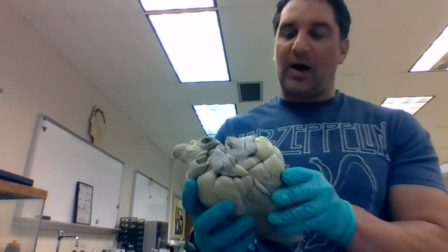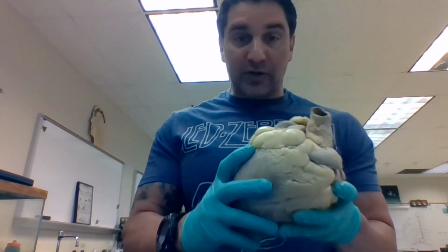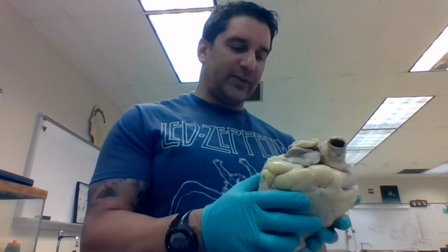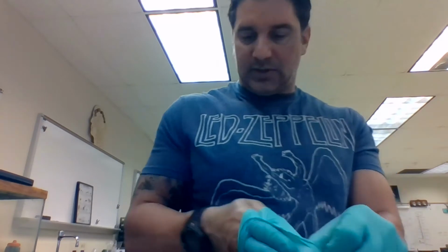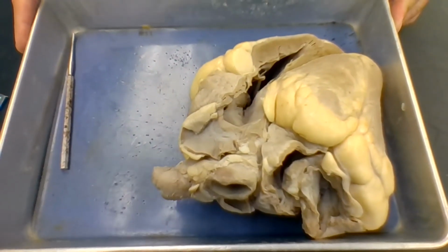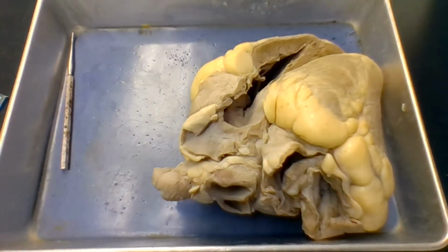Okay, but for today, I'm going to use something a little bigger. I'm going to use this. It's a cow heart. So this is a lot larger, wouldn't fit in here, obviously. This belongs to a cow, but it's bigger, so we can see all the structures a lot better in this. Okay. So what I'm going to do now is I'm going to tilt this camera up. So I'm going to change my gloves. I'm going to tilt this camera up so we can get a real good look at this heart. Hopefully I can do this without it falling. Okay. There. Get some gloves on again.